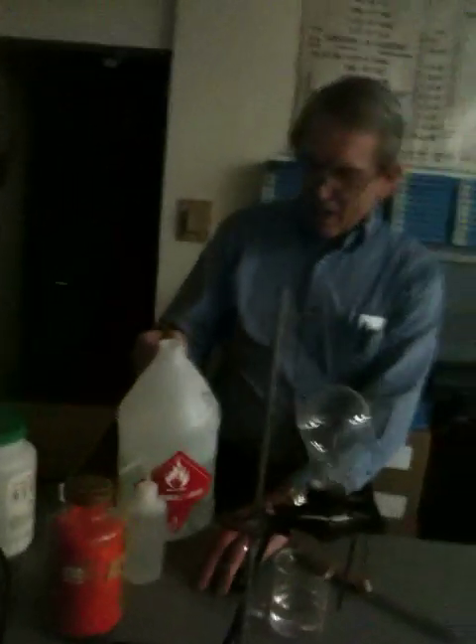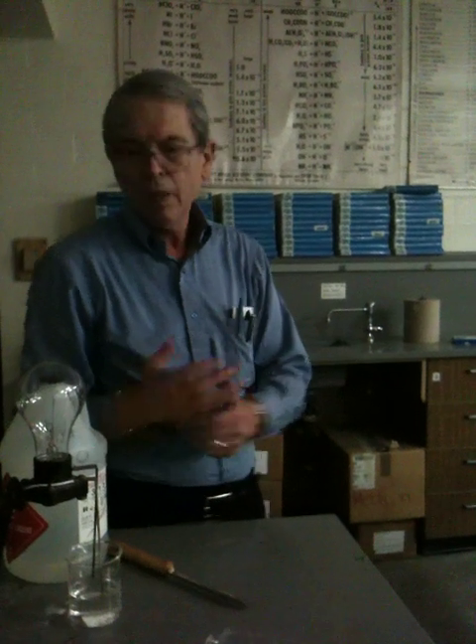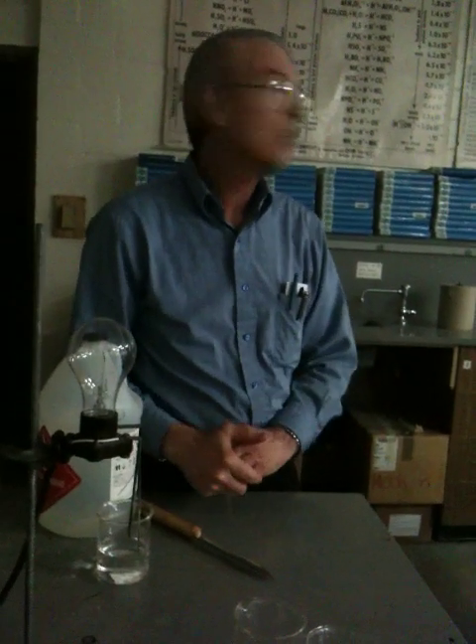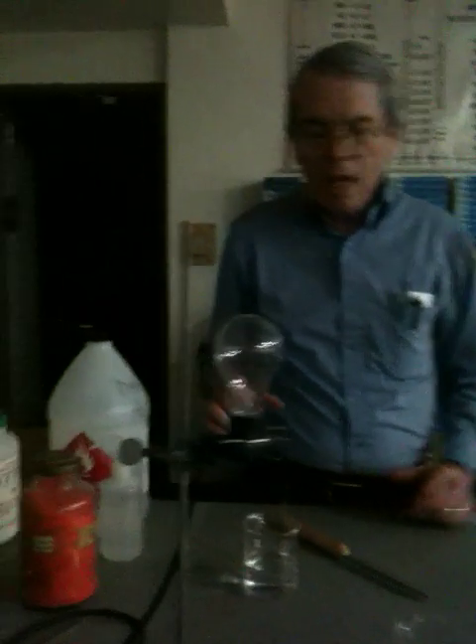What water did I use the first time? This is not distilled. Instead of distilled, we have a deionizer. It's a big tube about this big, and we run water through it like you do through a water softener, and instead of taking the calcium out, it takes all of the ions out. What we are left with is something that won't conduct electricity because there are no ions in the water. It tastes really flat, but the taste of water comes from the stuff that's dissolved in it. When you drink soda or anything like that, you're getting the taste of the stuff they put into it.